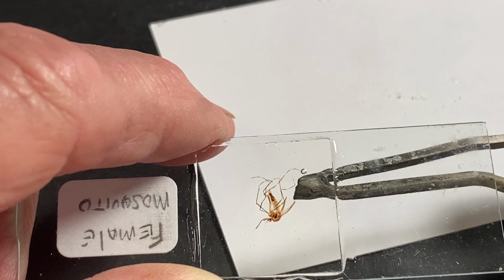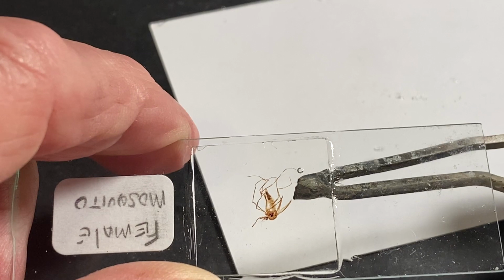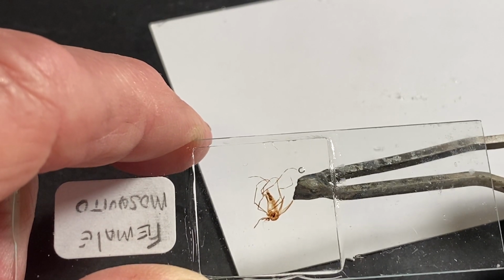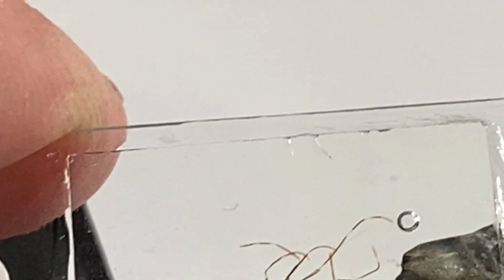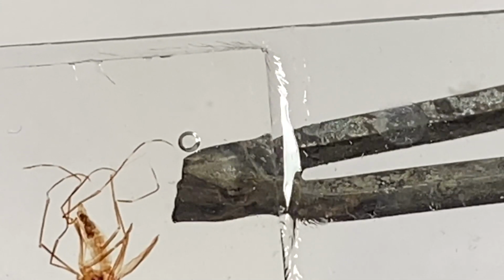With a hair dryer, it heats up everything, and you don't want to necessarily heat up everything. The rest of the slide is okay. It's just this one here that is troublesome. So let's see if this one becomes problematic for me. Let me see if it's moving or not. Nothing's happening yet. Okay, but we'll do it again.